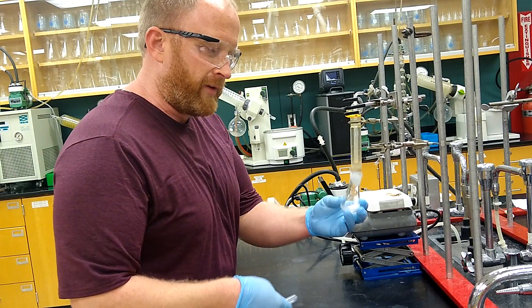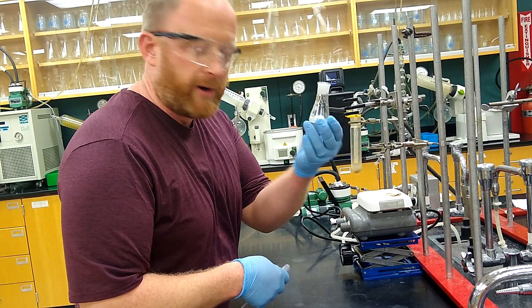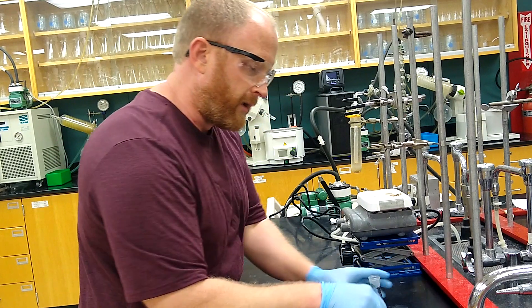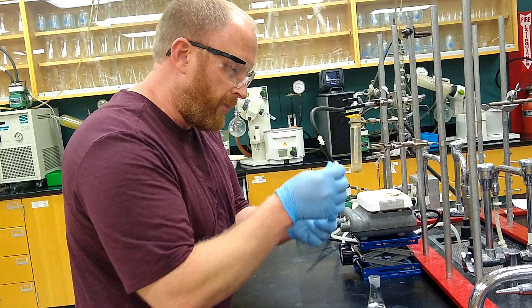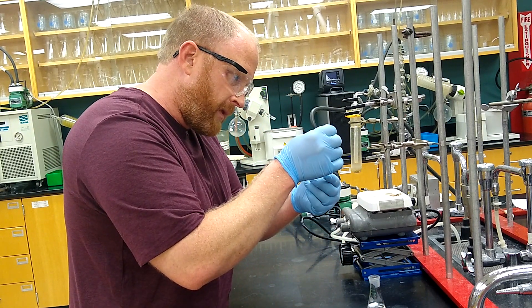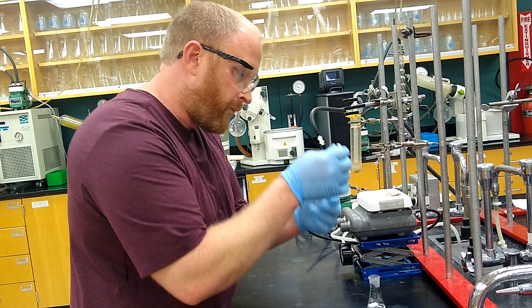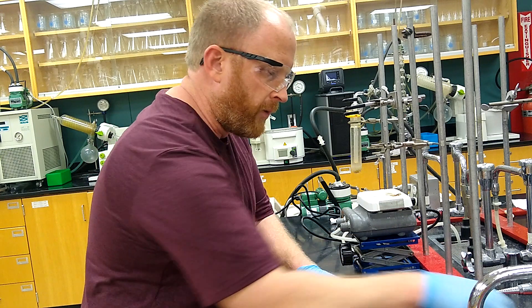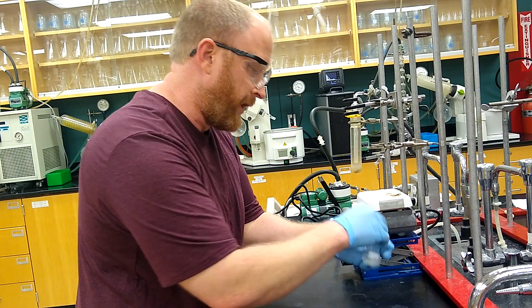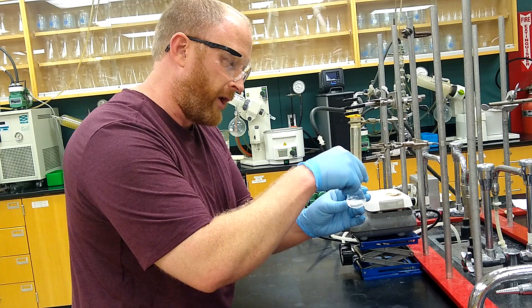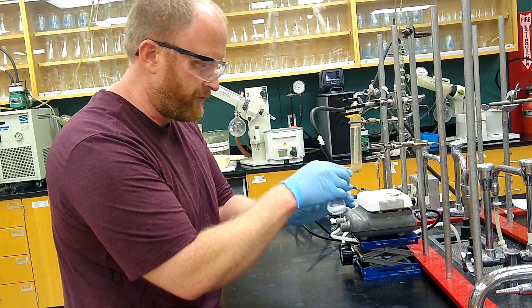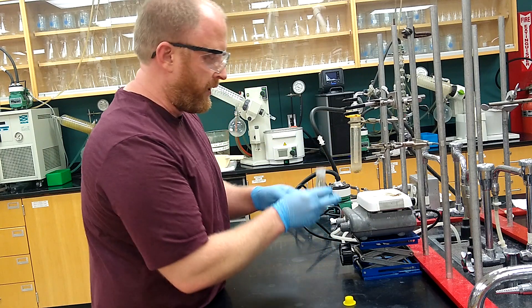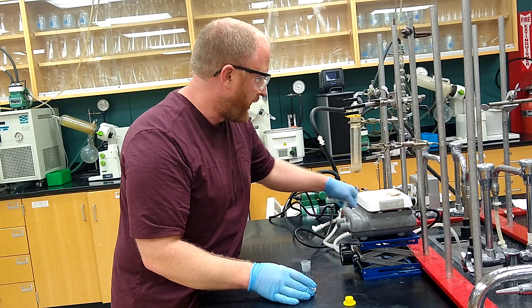Now we've got deprotonated p-cresol in aqueous NaOH, and we're ready to add our bromopropane. We're adding that in excess for the SN2 reaction, so increasing the concentration will increase the rate. Now it's just a matter of refluxing this for about an hour.